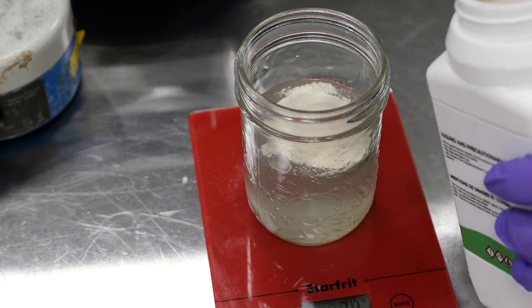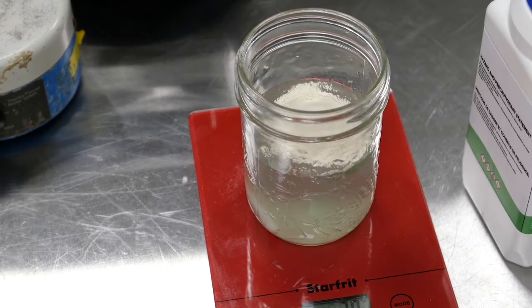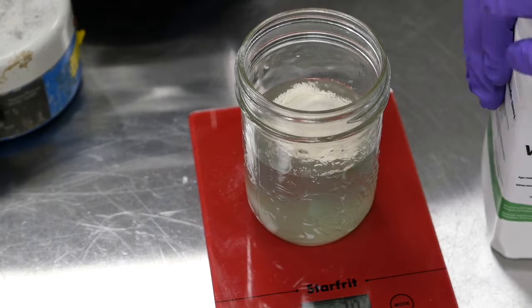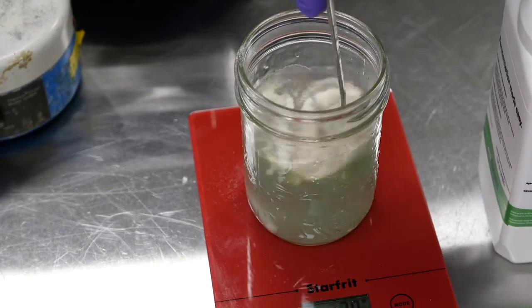Now when we're making agar, we're really just cooking for microbes. We have to think of it that way. We're cooking up some tasty treats that our microbes are going to want to eat. I'm going to give that just a little bit of a mix with the spoon.